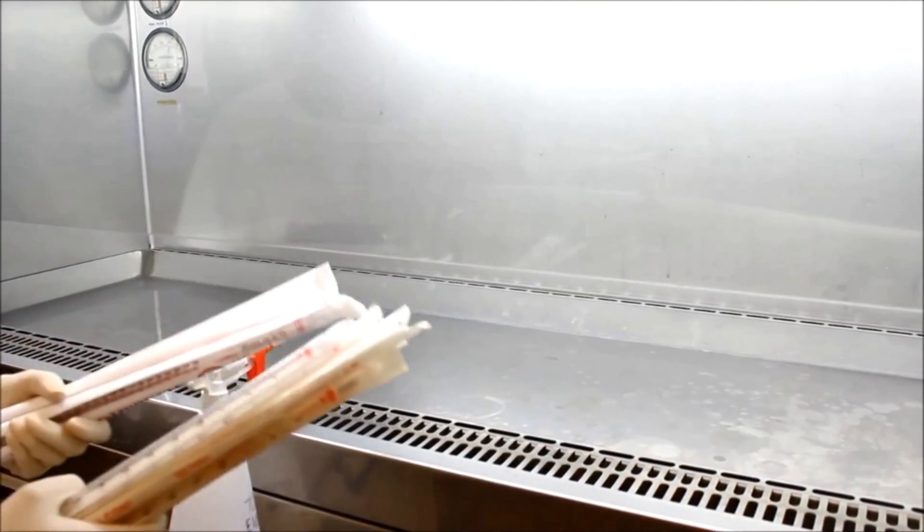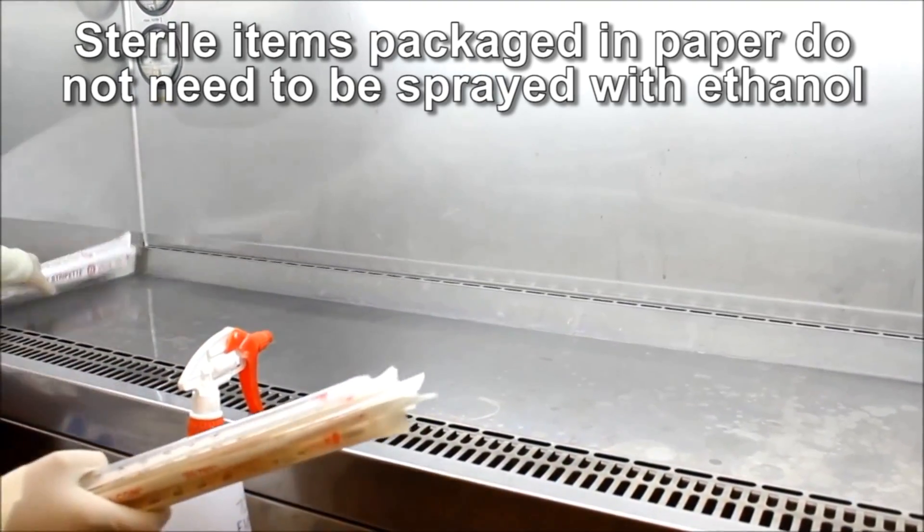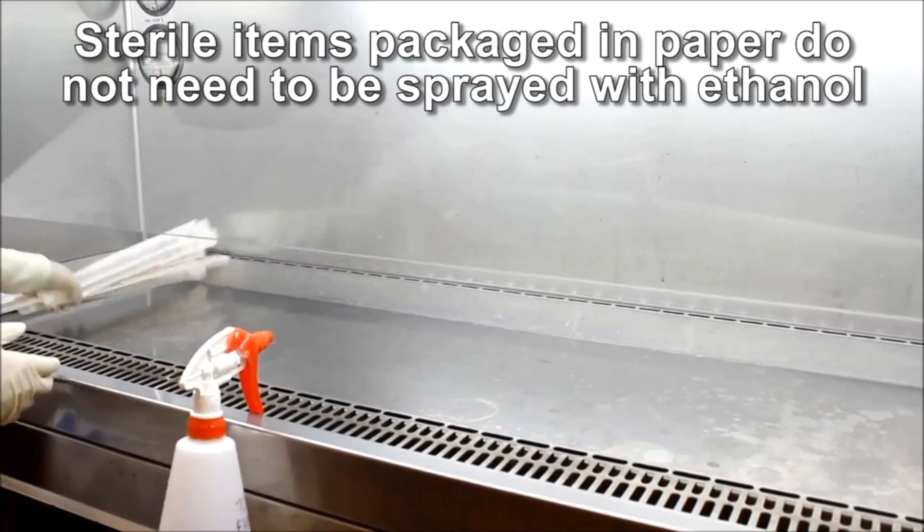Set up your workspace. When putting items into the cabinet, place them neatly and within reach. Sterile items packaged in paper, for example pipettes, can be placed directly into the cabinet.